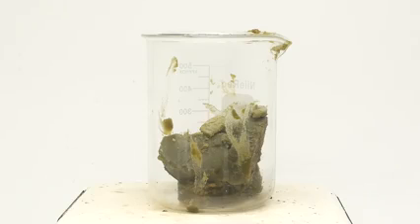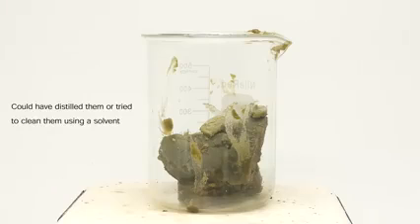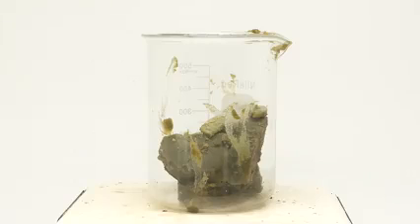Anyway, moving on, these are the fatty acids that I've isolated. In theory, they should be colorless or white, but for some reason they're green. The label said there were no dyes or colorants present, so I guess the olive oil that was used to make the soap was just not super pure. This is not at all to say that the olive oil they used was bad, it just means that it wasn't heavily refined. Anyway, now I need to connect them to glycerol to make triglycerides.